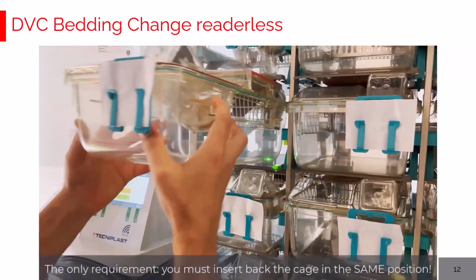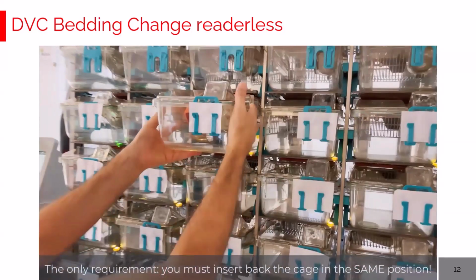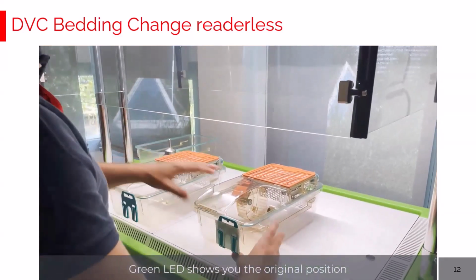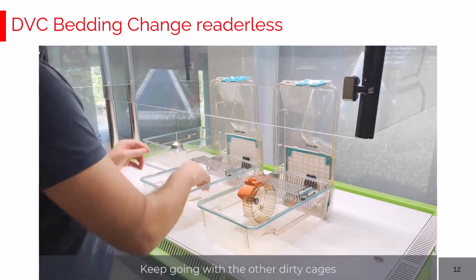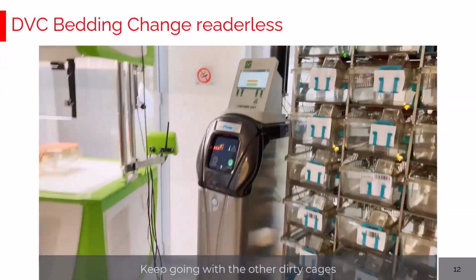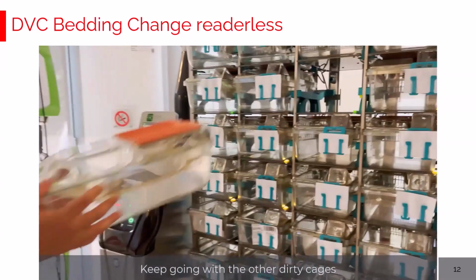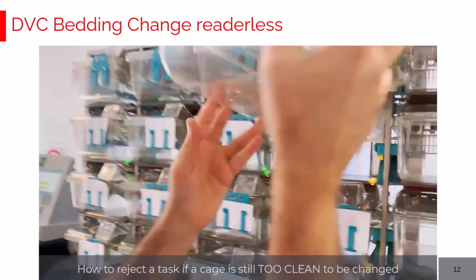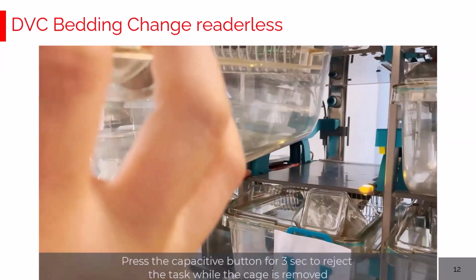And now, to accomplish this task, to be tracked by the DVC system, there is only one requirement. The cage must be inserted exactly in the same position. And then keep going with the other position, the other yellow LED lights. Exactly as said: dirty, clean, moving the animals, closing the cage, and inserting back, as a requirement, to the same cage slot.